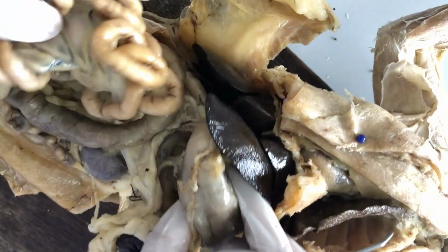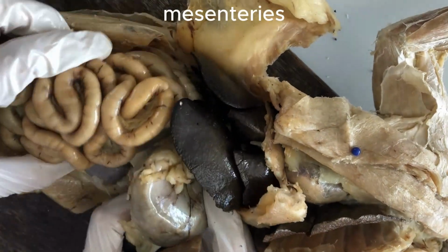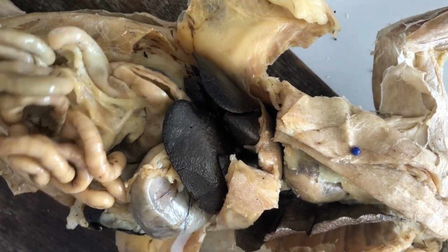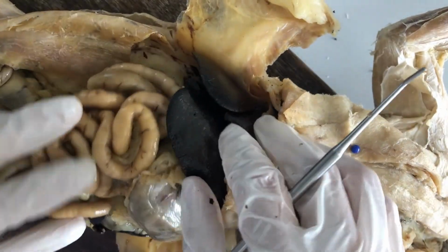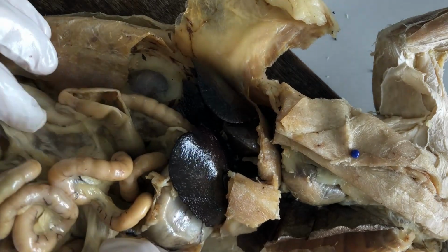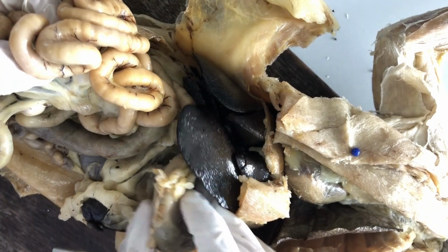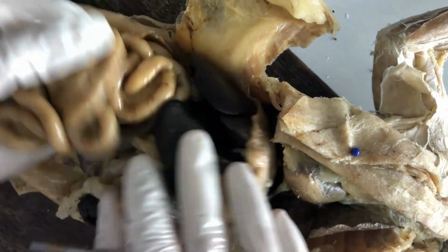Right, and there are a bunch of fatty connective tissues that I'll talk about in a separate video. Those are mesenteries that suspend the visceral organs inside the cavity so that they won't be disarranged. The stomach would end up here, the liver would end up here. So that doesn't happen because of the mesenteries, helping suspend the visceral organs inside the cavity, keeping their positions while allowing for some degree of movement, so they can jostle around like that.